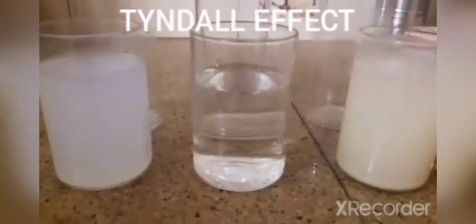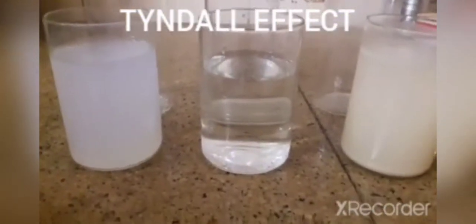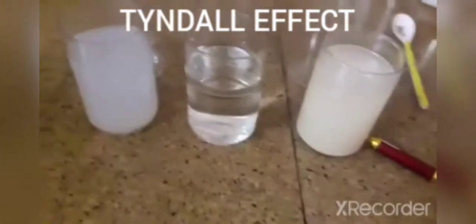So the first one is whether the mixtures are clear. As we can clearly see, only the true solution is clear. So I'll mark yes for sugar and water and no for the rest. Next is, after we sieve them, is there any residue left?